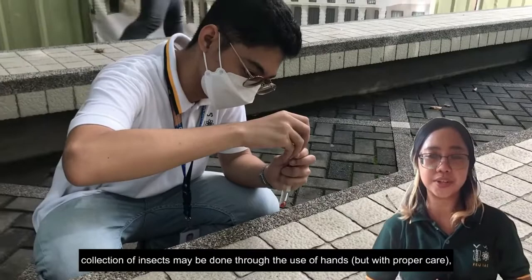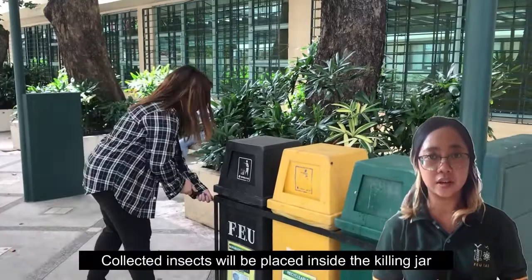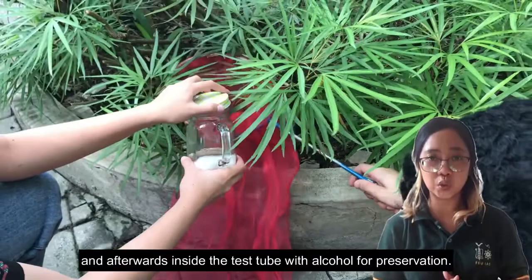For general hand collection, insects may be collected through the use of hands with proper care, tweezers, or insect nets. Collected insects will be placed inside a killing jar and afterwards inside a test tube with alcohol for preservation.